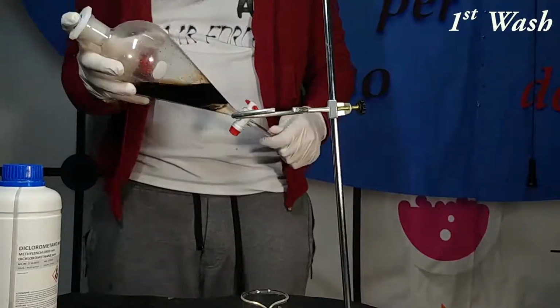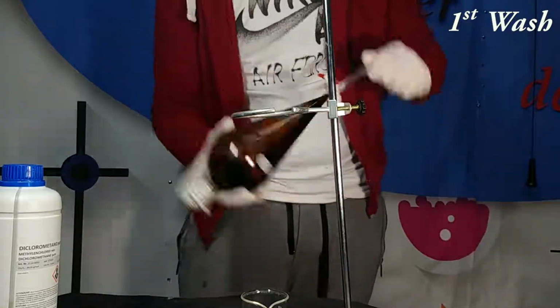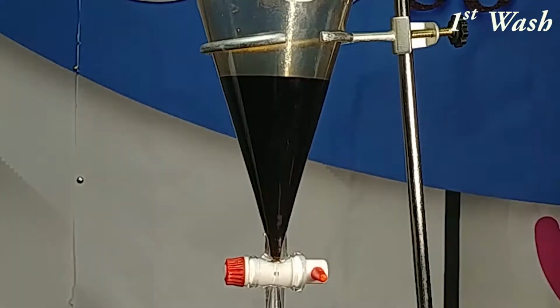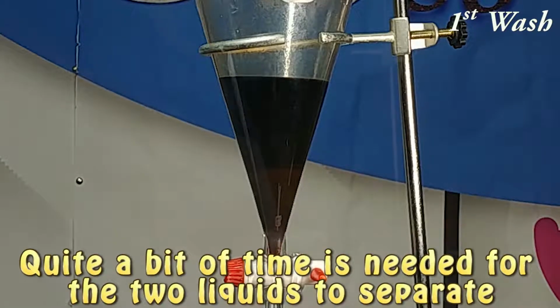In fact, as we know, in our solution different compounds are dissolved, and DCM is able to extract only caffeine from water. Also, we want you to know that this step might be done also just one time, but doing it several times increases our extraction capability.